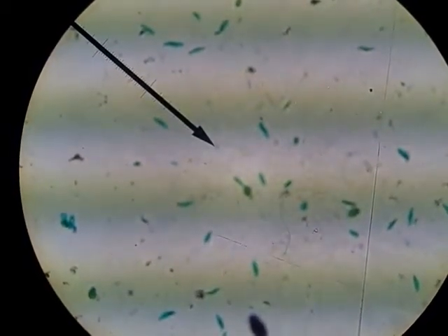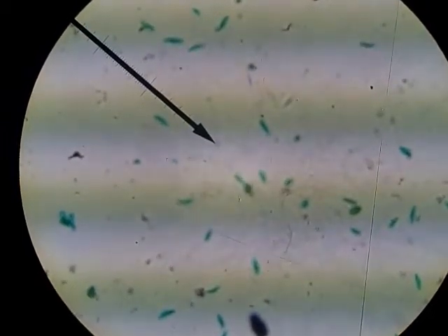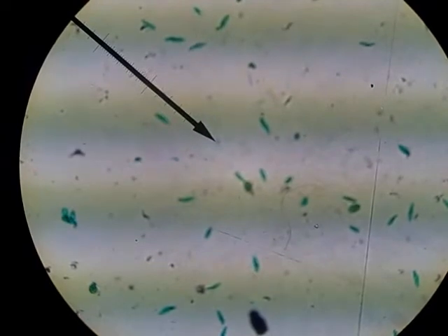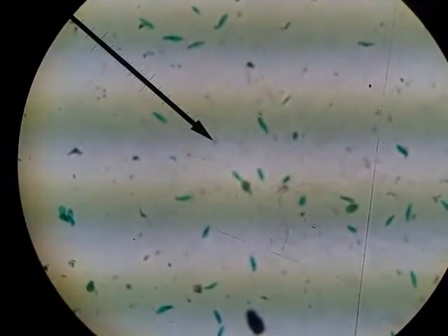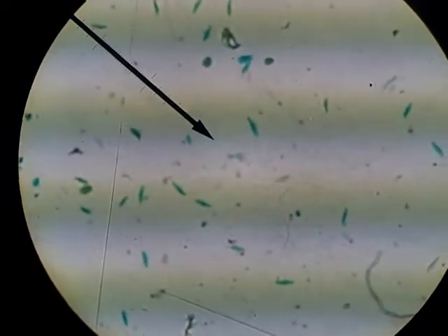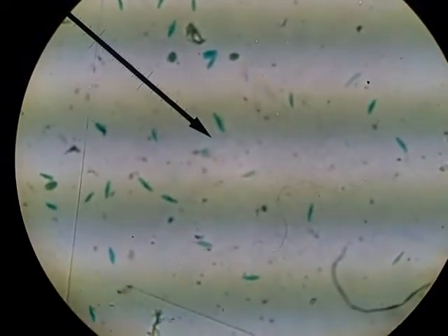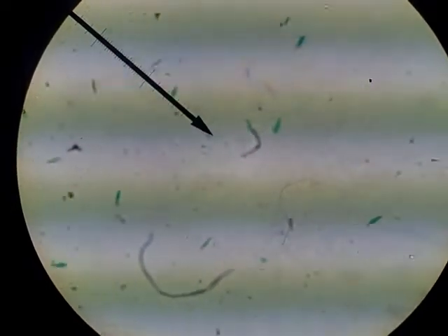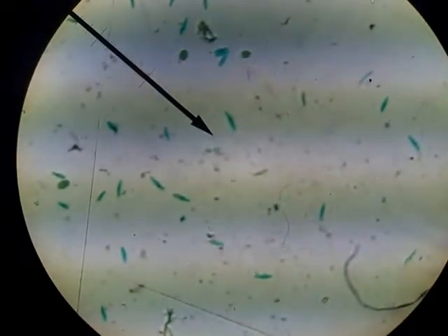Once you have it in focus, you'll then use your fine focus back and forth to further sharpen up your image. I'm going to show you now how to focus an image. I would look for the largest organism or the largest specimen on here that looks interesting, that you may want to take a closer look at with your mechanical stage, and center that object up.